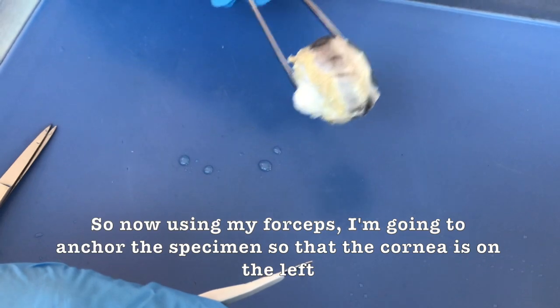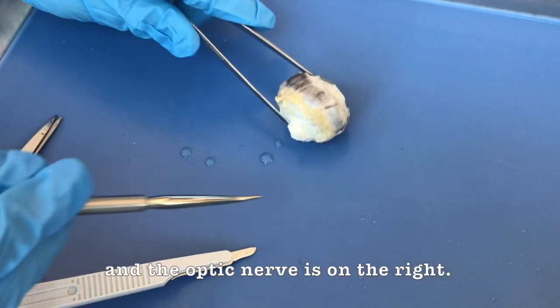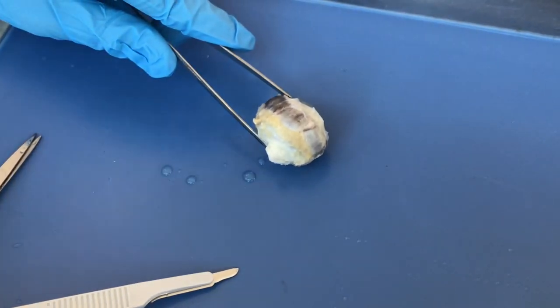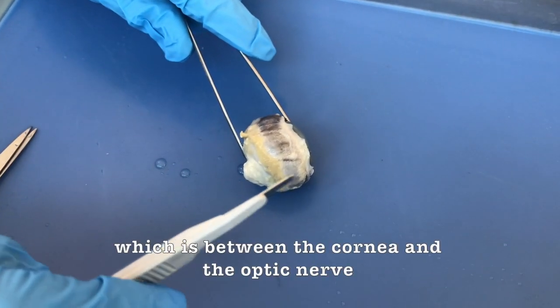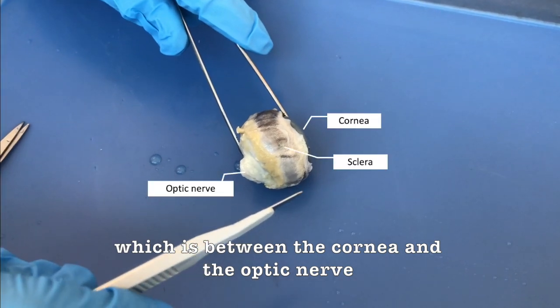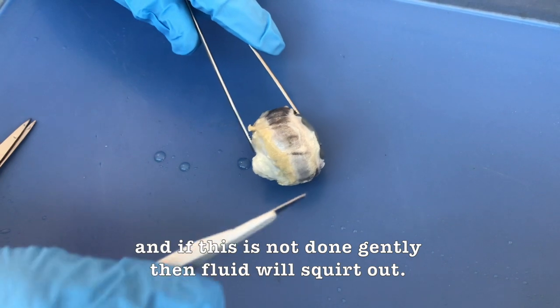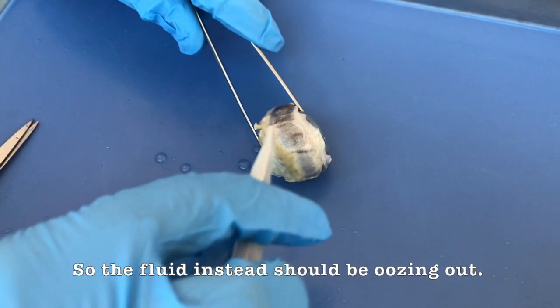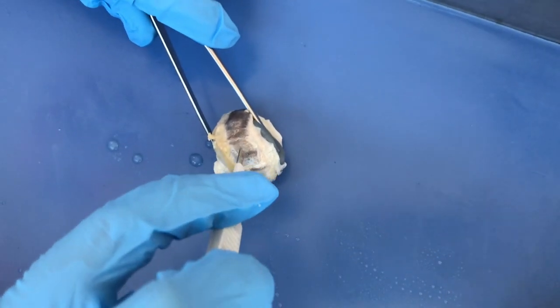So now, using my forceps, I'm going to anchor the specimen so that the cornea is on the left and the optic nerve is on the right. Then with the scalpel, I'm going to gently make an incision on the sclera, which is between the cornea and the optic nerve. And if this is not done gently, then fluid will squirt out. So the fluid instead should be oozing out. And remember, we are going to want to cut away from our bodies.